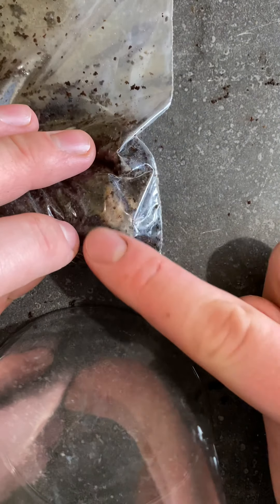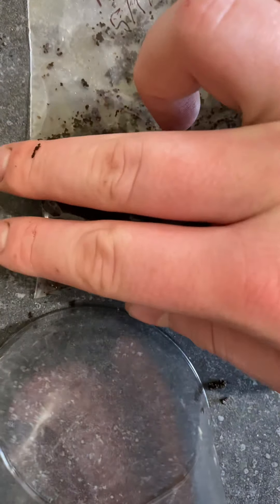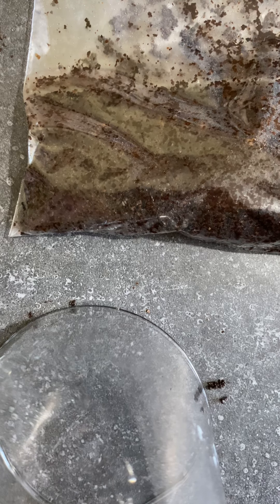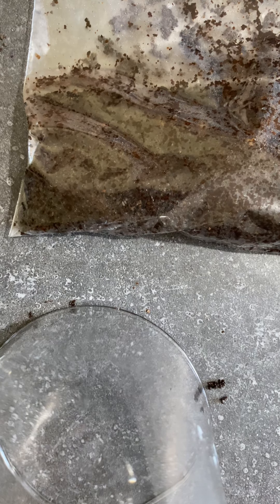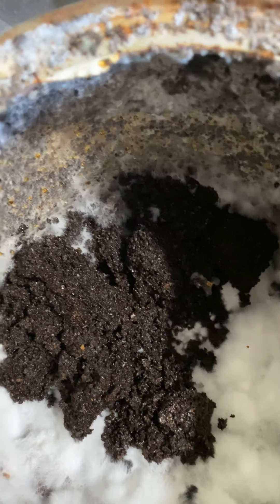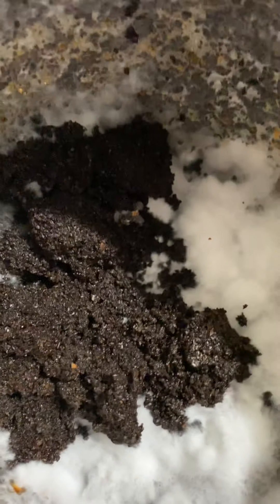So what will happen is these will revert back into mycelium, then it will just run across, making this basically pure morel mycelium. And I can expand that like how I have been expanding my other species. Here is what I thought was kind of a woods variety, but when I was able to fruit it, it turned out to be some oyster variety — I got gypped. That yellow right there, that is metabolites. It's a more naturalized spawn because it was exposed to outside air. It's what I used to inoculate the bale, and you can see it's been regrowing just fine as coffee grounds were added two days ago — you can already see they're being inoculated.